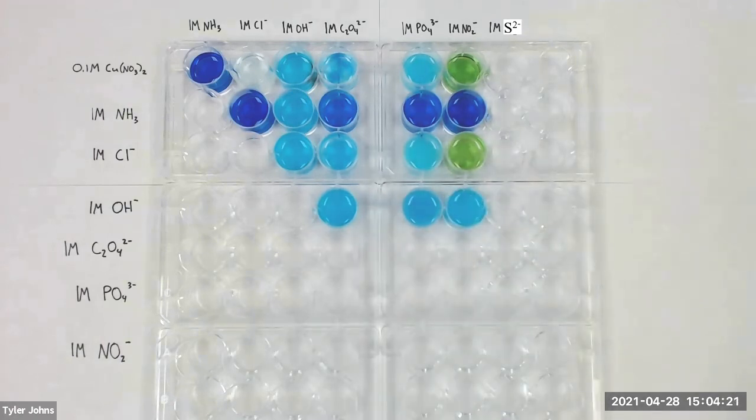We will next perform stability tests for oxalate ion using the wells in the fifth row.